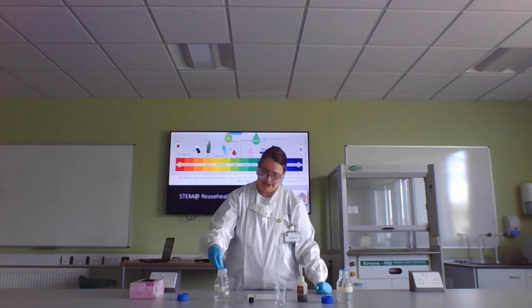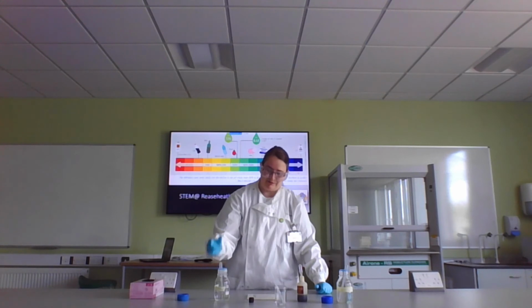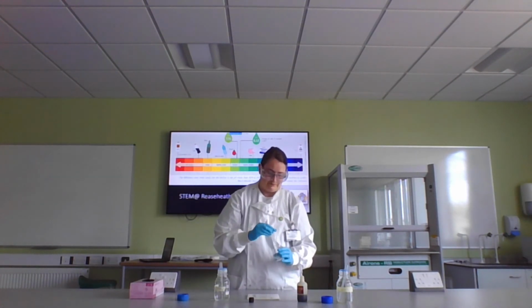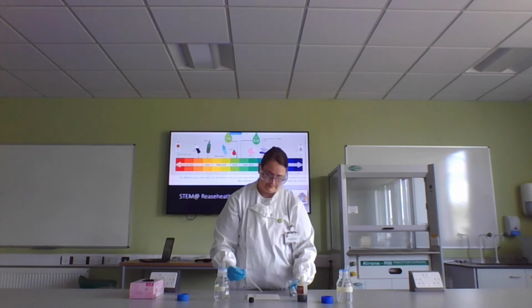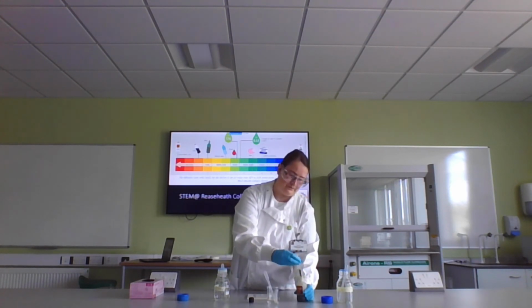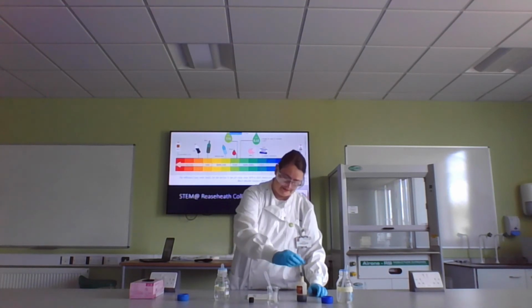So what that tells us is we need a little bit more sodium hydroxide, because we want it to be more alkaline, which it isn't at the moment. Let's try that again. Oh, not bad.